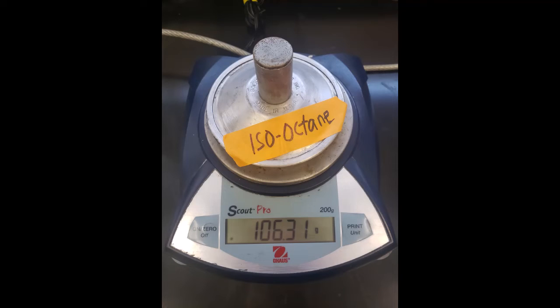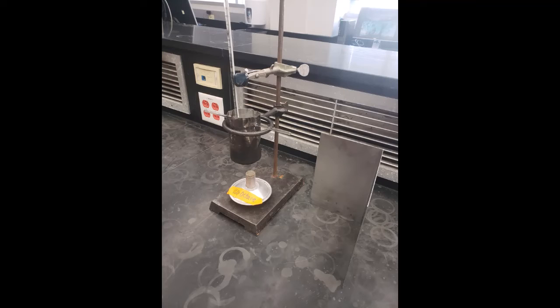After this, measure the fuel burner's mass, and make sure that the cap is on the burner when measuring. This gives a value of 106.31 grams. Next, configure the apparatus as it is shown. To reiterate, the soda can with water will be mounted above your fuel burner, held by a glass rod and holding a thermometer above it. The apparatus will then be encircled by a draft shield, so that the flame is stable and does not flicker away from the calorimeter. With this, you are now ready to begin the experiment.